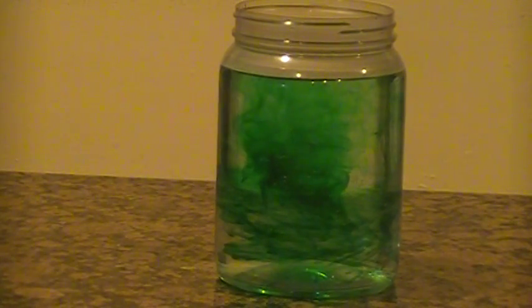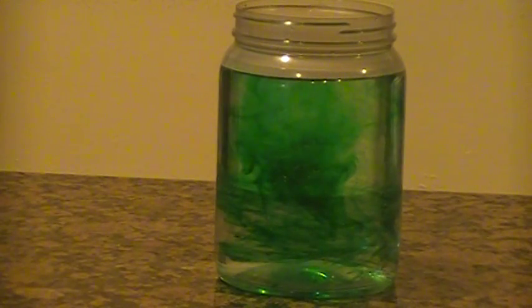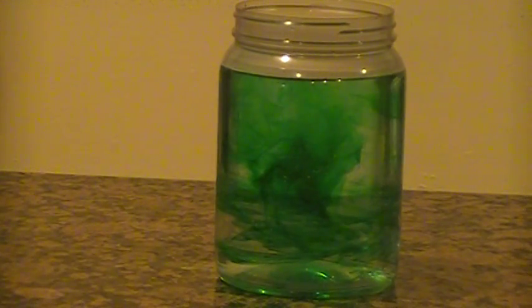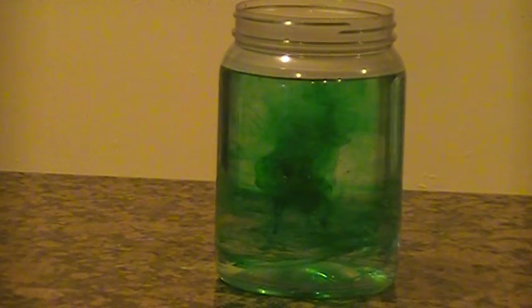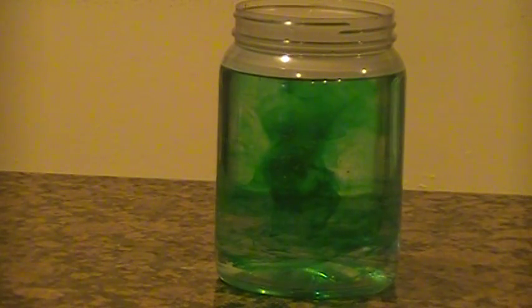and the water will become a single shade of transparent green. Once this happens, diffusion will no longer be occurring because there is no more movement of dye from one area to another.